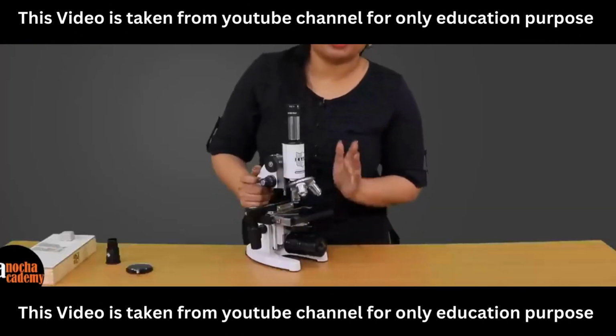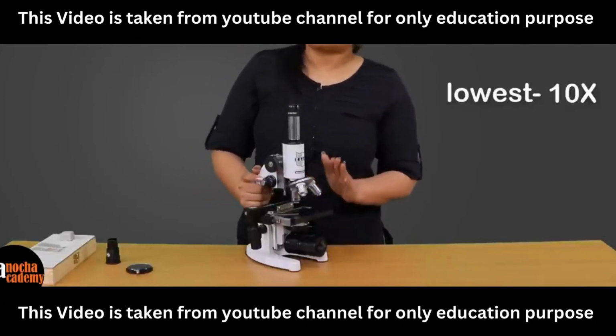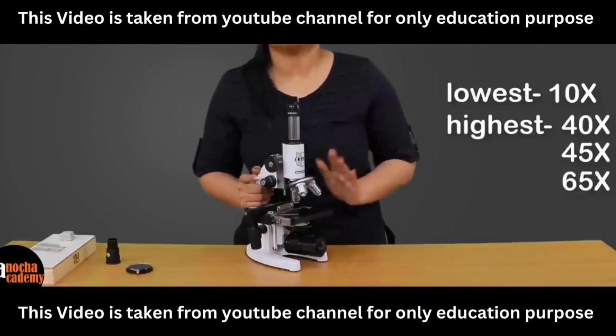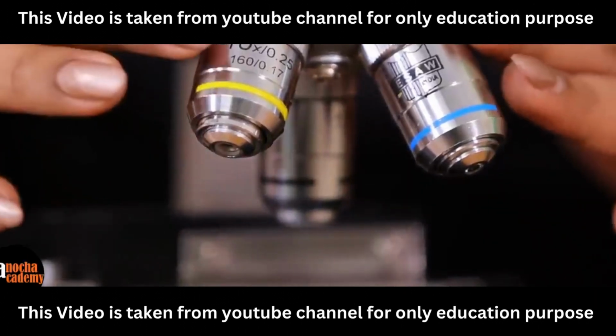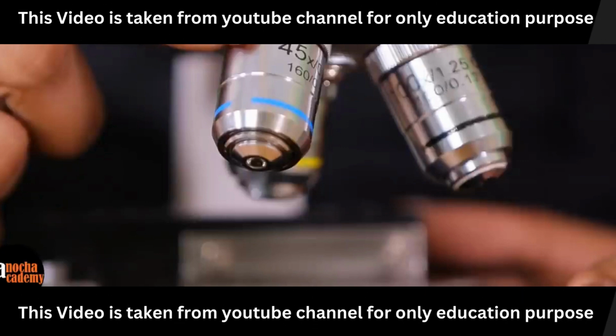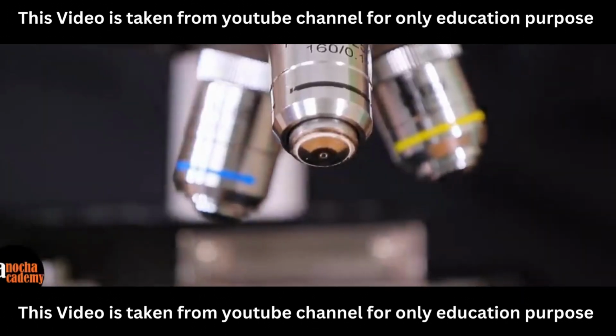The lowest power here is usually 10 times, that is 10x, and the highest power is usually 40x, 45x or 65x. Here we have three magnifications for the objective lens: 10x, which is low power, 45x, which is higher than 10x, and 100x, which is the highest power in this microscope.